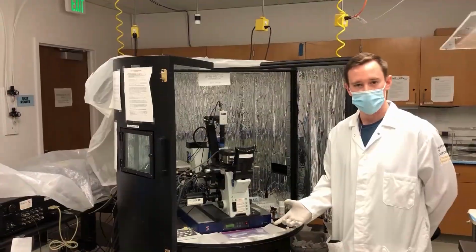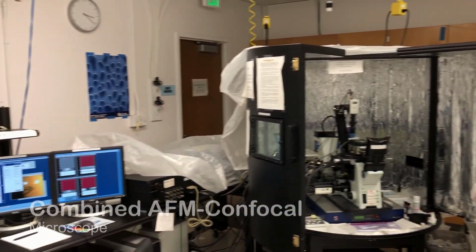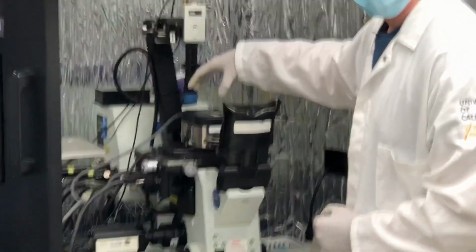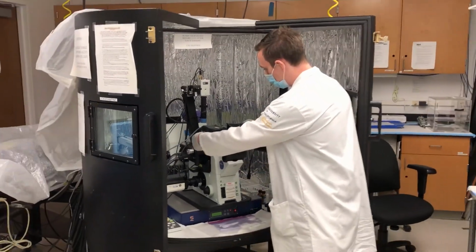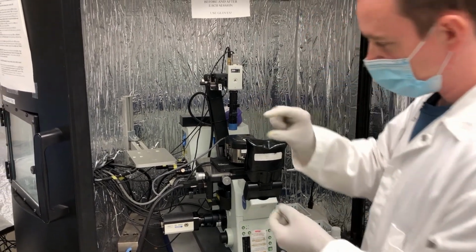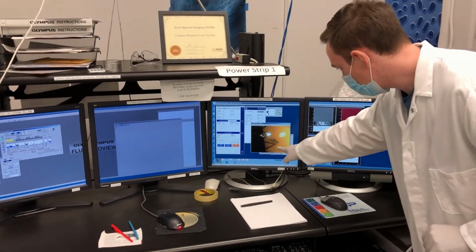One more microscope, it's called the Confocal Microscope. Right now, I am actually imaging a piece of gold. And what you can see here, this is the inverted microscope for the confocal. And this part right here is the AFM head, atomic force microscope head. And my sample is laying down. I have piezo scanners that are moving forward, backward, up and down to do this raster scan. And then my head right here has a Z piezo that will move up and down based off this feedback loop. And you can see here in this image, you can see actually right now I'm imaging.